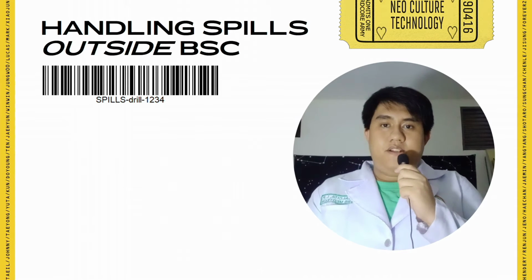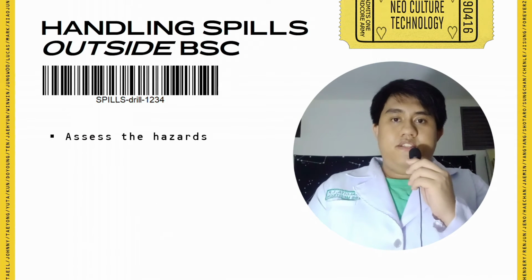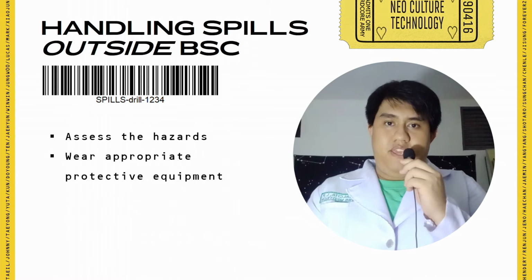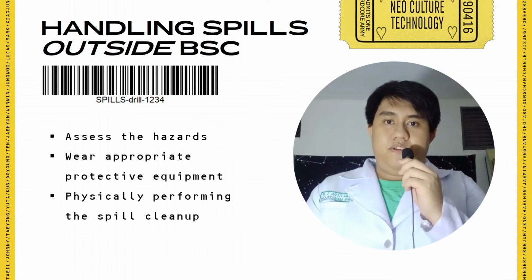In handling spills outside the BSC, what we do first is we assess the hazard. Second is we wear appropriate PPE. And the third one is we perform the actual cleanup.